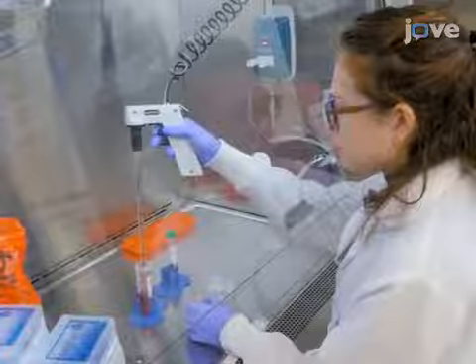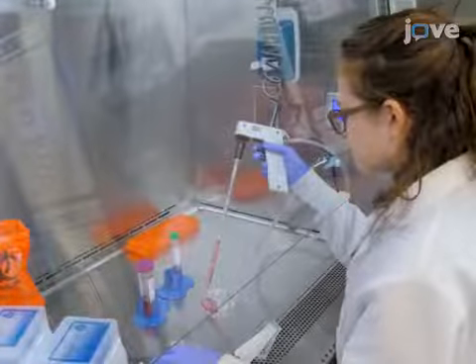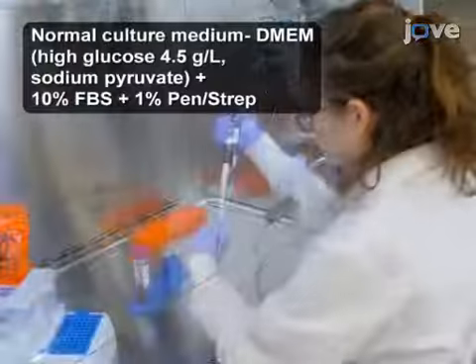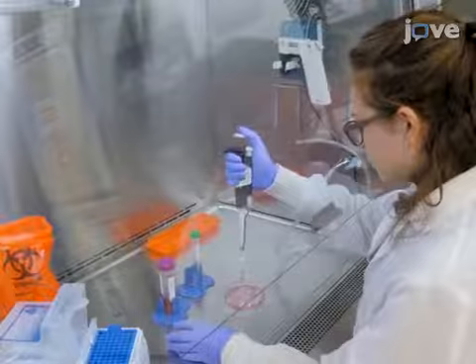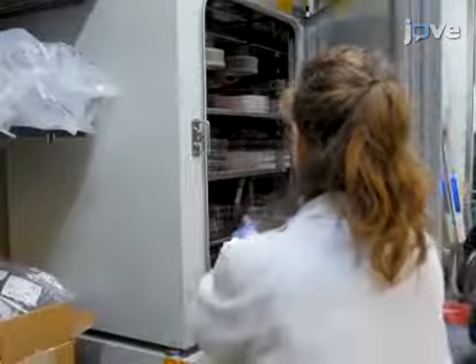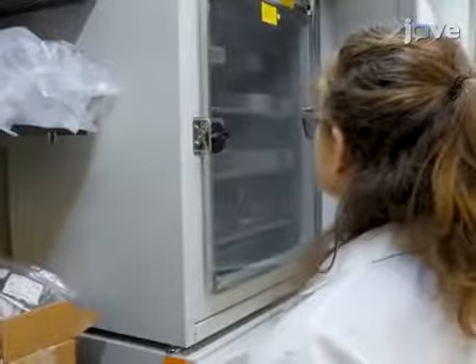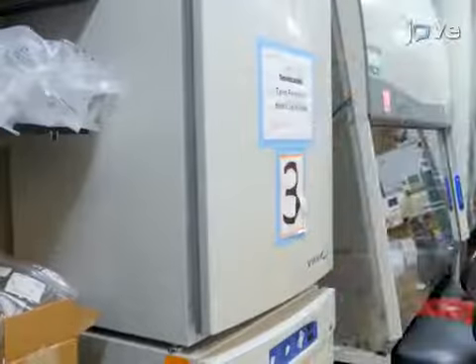A day prior to transfection, plate 5 million HEK293 T cells in a 100 mm cell culture dish in 10 milliliters of normal cell culture medium. Incubate these cells at 37 degrees Celsius for 24 hours in a humidified incubator with 5% carbon dioxide.